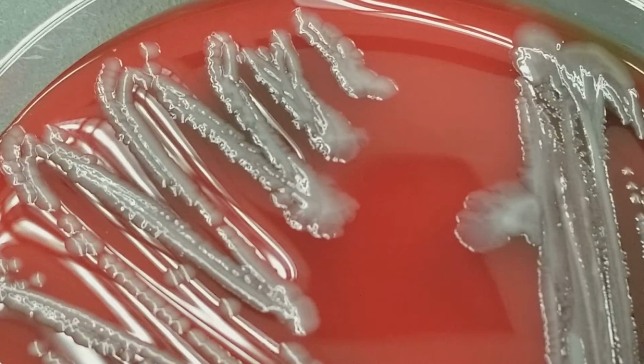If this had actually been on a plate that had just been plated from the specimen, since it's a pathogen, you would notice that it would basically take over the plate. The family Enterobacteriaceae divides very rapidly anyway, but that's basically one of the big ways that you can tell if something is a pathogen versus normal flora is the existence of hemolysis.